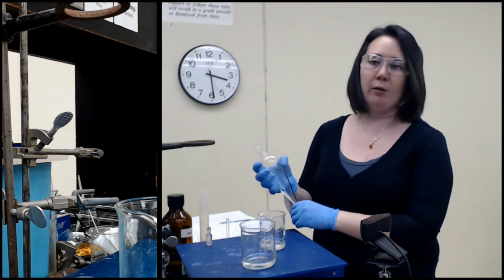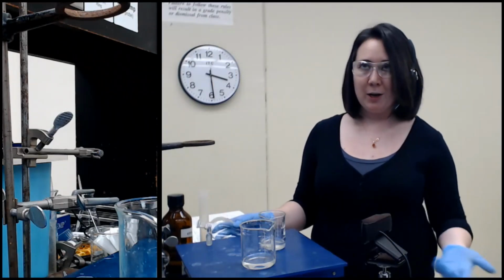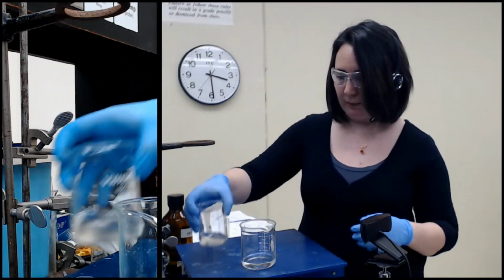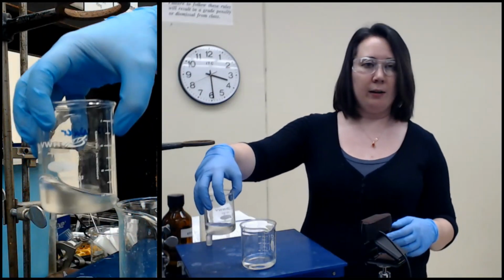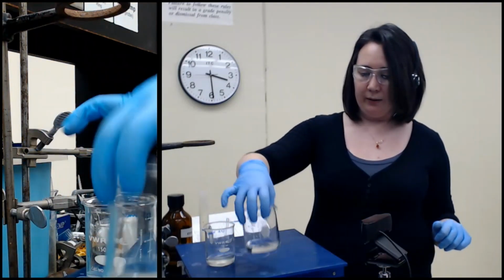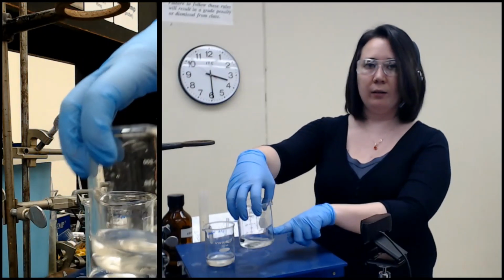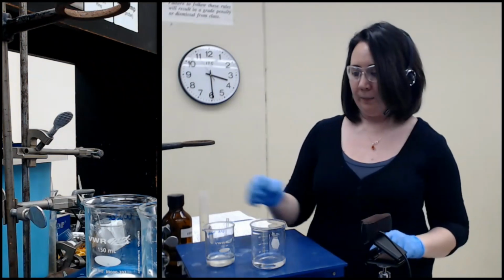Again, our whole goal is separation here, separation, method of purification. So, you want to try to avoid mixing if you can help it. So this, ignore the writing, is just our ethyl acetate, which has one component in it. And this is our sodium bicarbonate, also known as our aqueous layer, and it has the salt of our other component in it. So this one's not done yet.